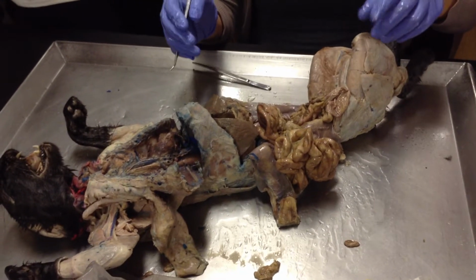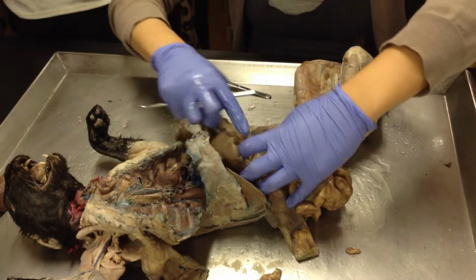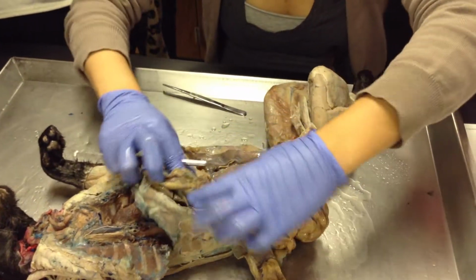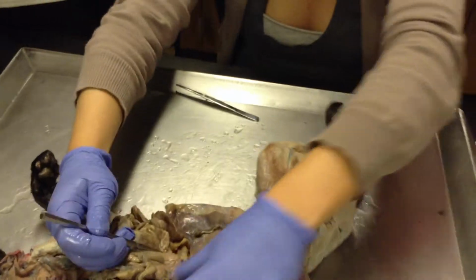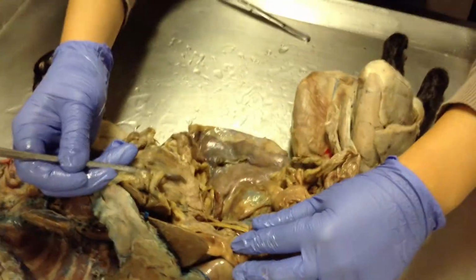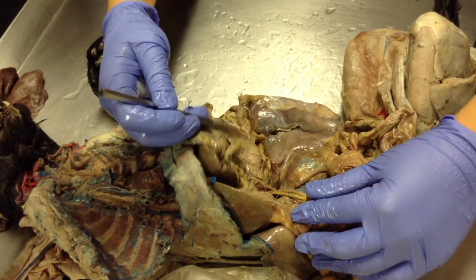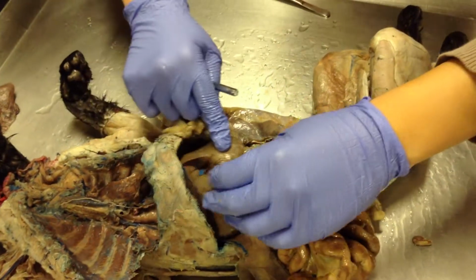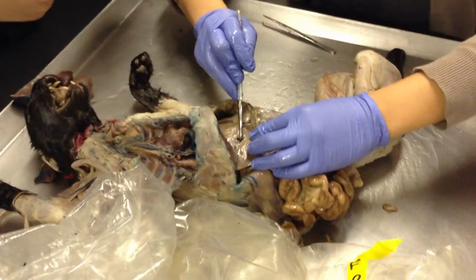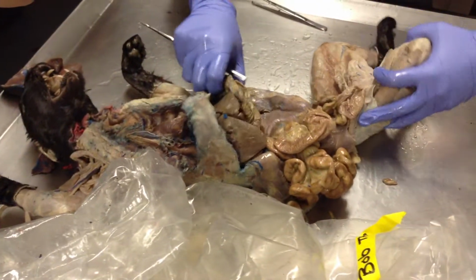The pancreas contributes how? Pancreatic juice, right? Which is located, if I lift up this guy. Do you guys see it here? If I pin this guy, this is the pancreas, right? Remember how to identify the pancreas. That's this structure right here. Okay. The gallbladder, this one's not colored, but generally it's green. That's how you'll find it. It's sort of between the lobes of the liver.